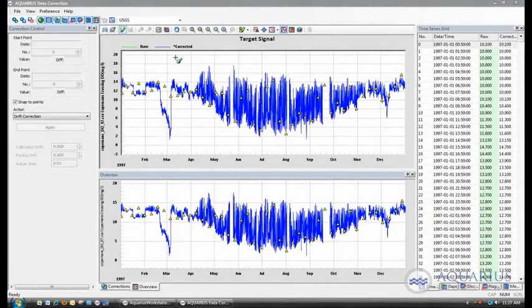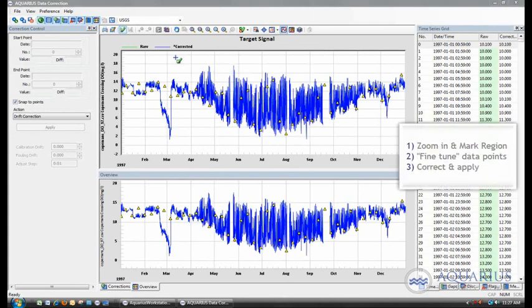In this second part of the data correction video, I'm going to run through how to perform a drift correction and an offset correction to a specific region of the data set. Now, the procedure is pretty standard no matter what actual correction you apply to the section of data, whether it be a deletion, a drift correction, a fouling drift.